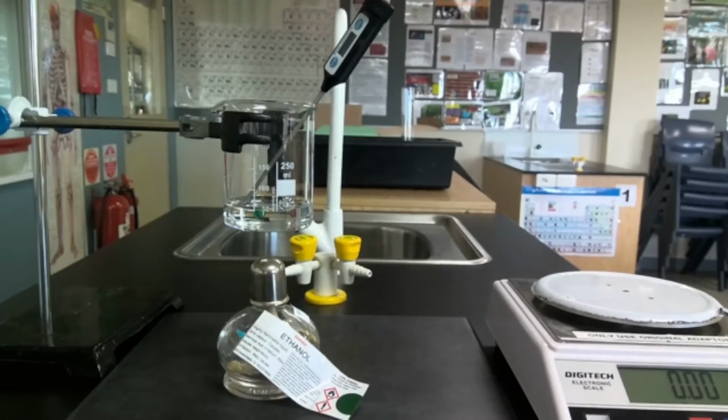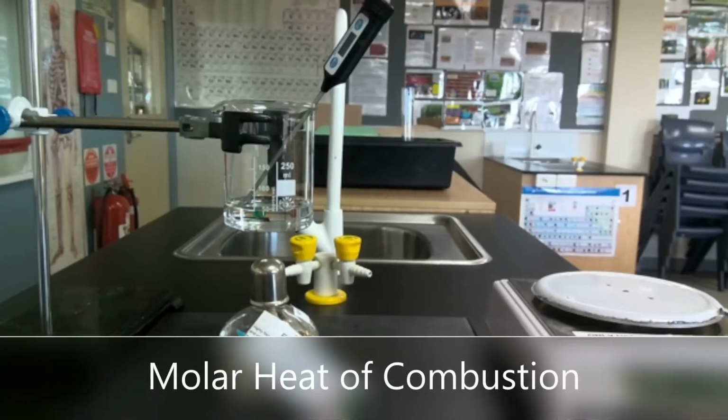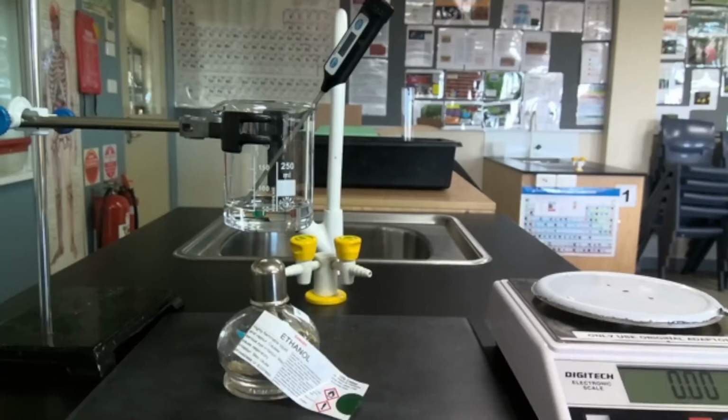Today we will be investigating the molar heat of combustion of two alcohols. We've got ethanol and butanol. Molar heat of combustion is the amount of heat energy that is released when a mole of a chemical is combusted. So what this experiment does is we calculate the change in enthalpy of our reactants as they convert into products.